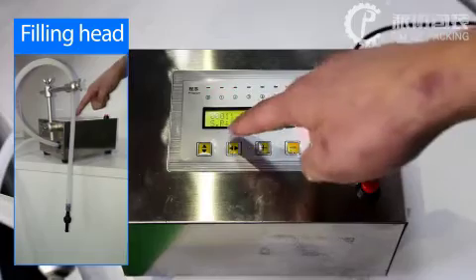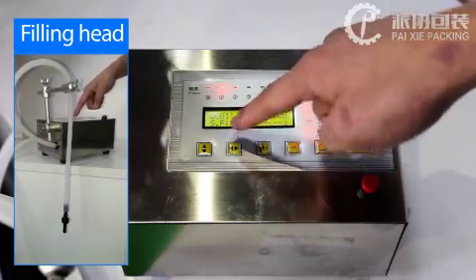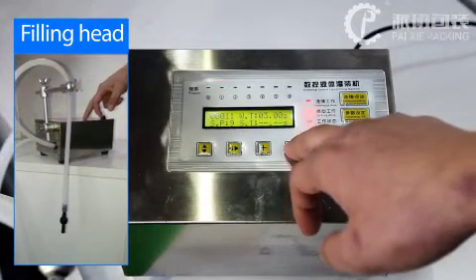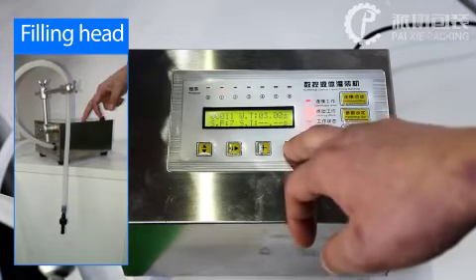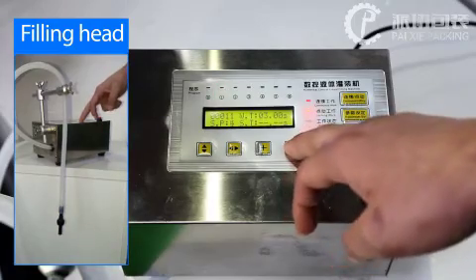And you can see the feeding speed. You can see the flashing dash. You can press minus. It goes to eight, number seven, number six, number five, and number four.